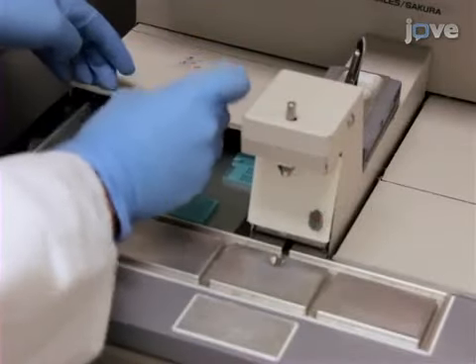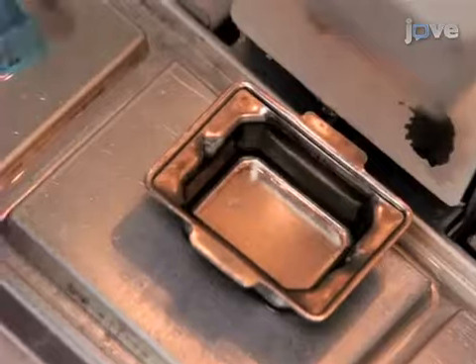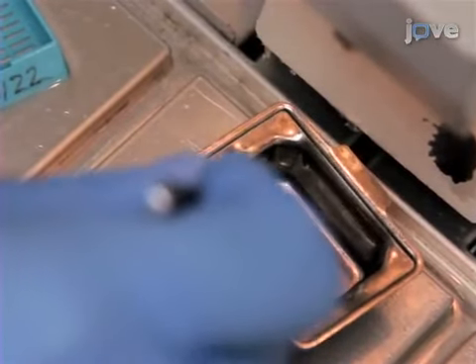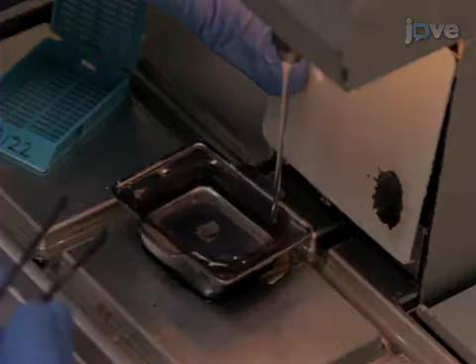Place each processed tissue into a deep histology mold, ensuring that the inner face of the heart is touching the base of the mold. Then pour melted paraffin wax to completely fill the mold.